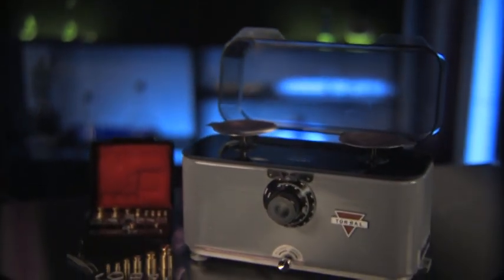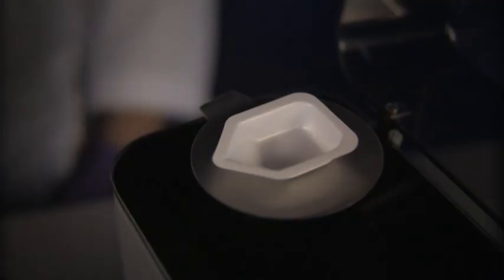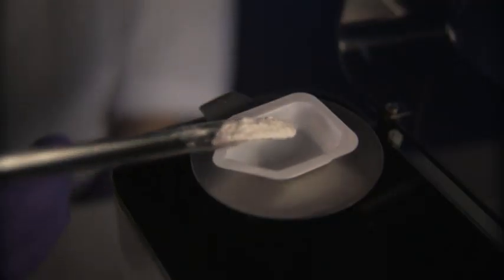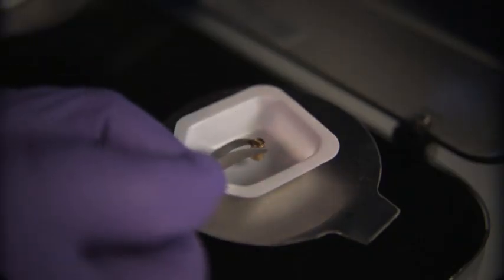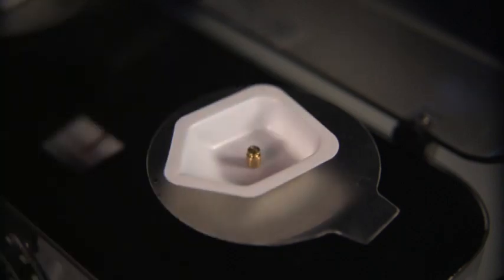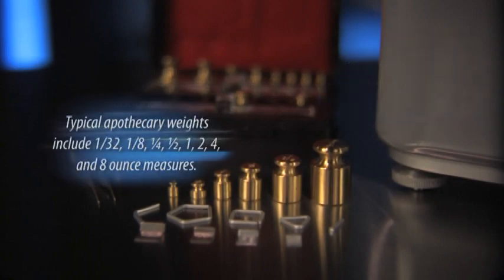First, let's look at the Class 3 or Class A balance, a two-pan balance that is used to weigh small amounts of ingredients. The material to be weighed is placed on one pan, and the pans are carefully brought into balance using a set of standardized weights placed on the second pan. Typical weight sets contain metric and apothecary weights.